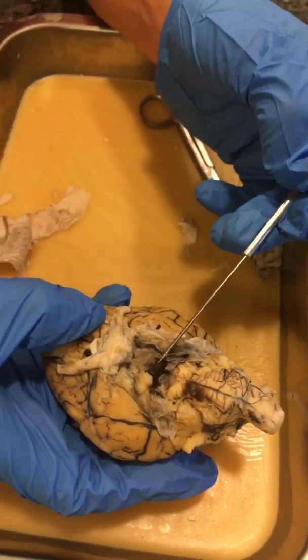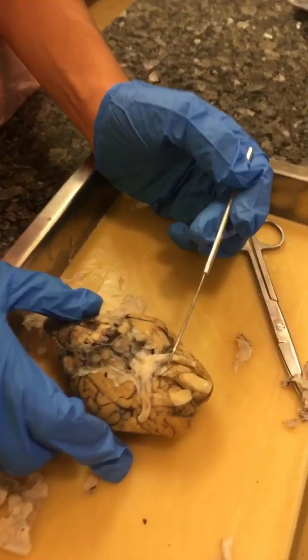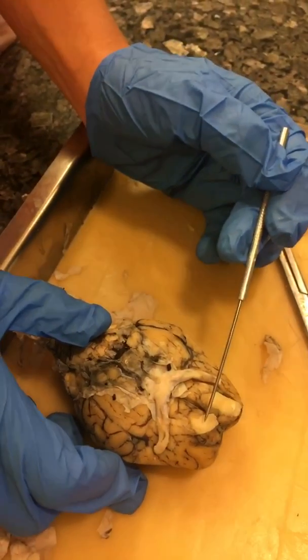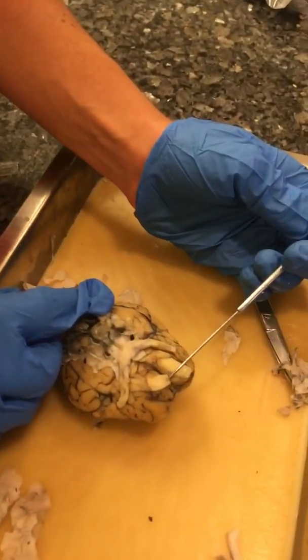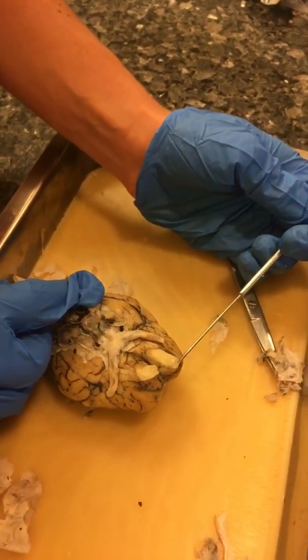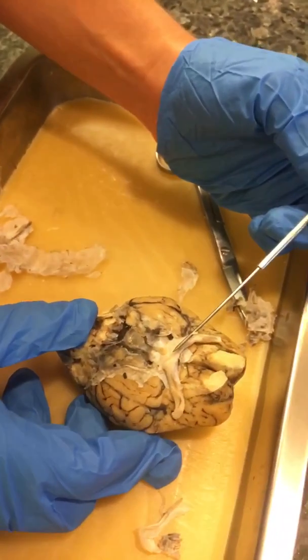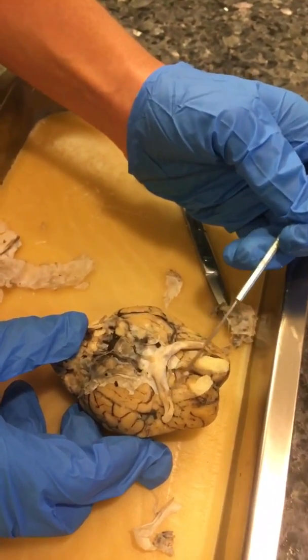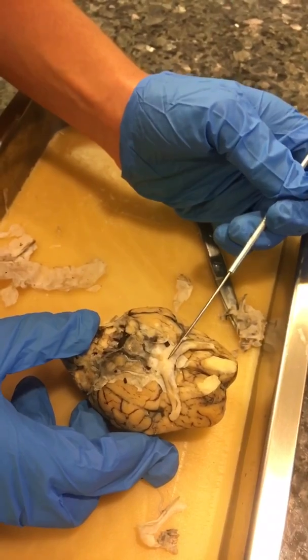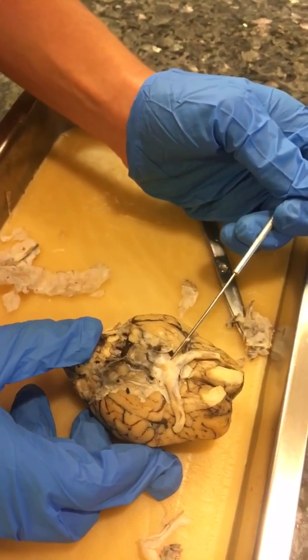Here we have the pituitary gland. For cranial nerve 1, the olfactory, we have the olfactory bulb and here we have the olfactory nerve. For cranial nerve 2, this is the optic nerve, this is the optic chiasm, and this is the optic tract.